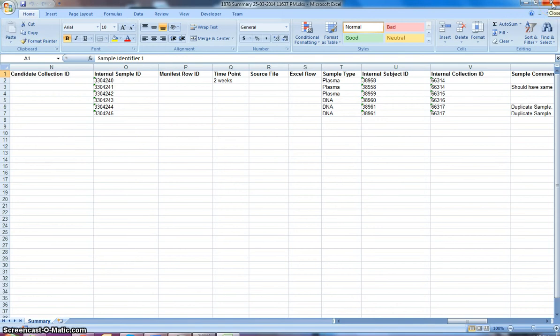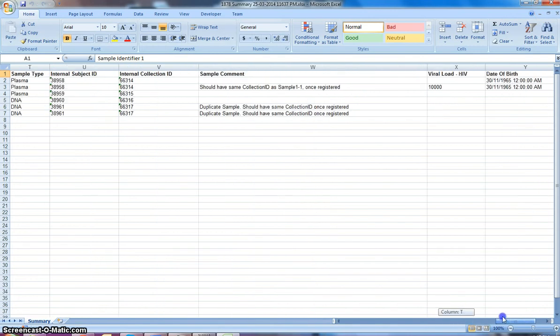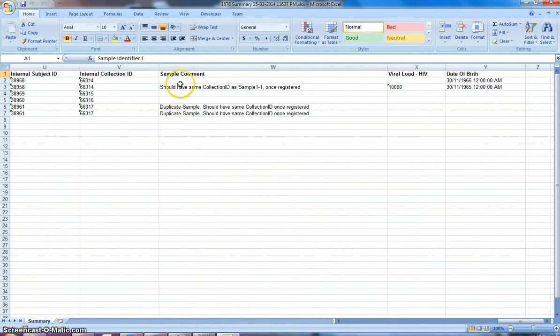The collection ID basically uniquely identifies the collection event, so if a bleed is taken from a subject at a certain time, that will have the same collection ID, even though that may have been pipetted into multiple tubes. So 2 tubes can have the same collection ID if the samples were sourced from the same collection event. And this spreadsheet just confirms what Linda has just registered. The rest of the sheet also has the sample comment, viral load, and date of birth as well.